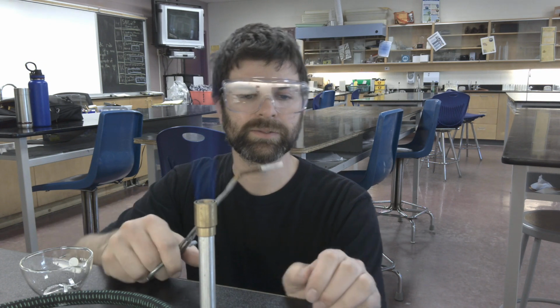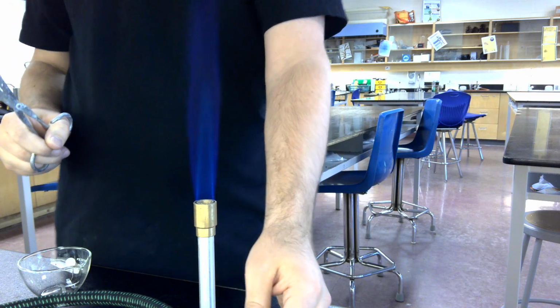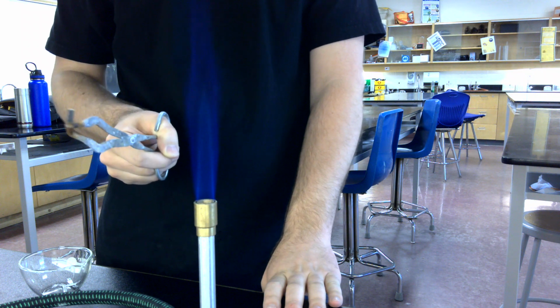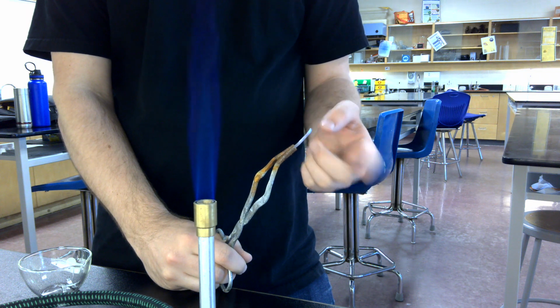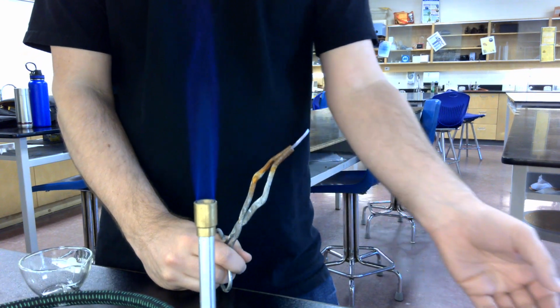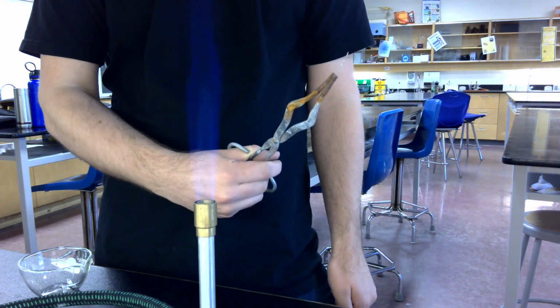Now, when you burn it, you can see on the flame there's usually an inner cone with a light blue flame. That will be the hottest part, so we're going to want to get the top of that cone when we burn this. Keep in mind this is a combustion reaction, so when you're recording your reactants, it is not only the magnesium that is reacting here. A combustion reaction is also oxygen reacting with something. It's the oxidation of things. So you're taking magnesium and reacting it with oxygen.